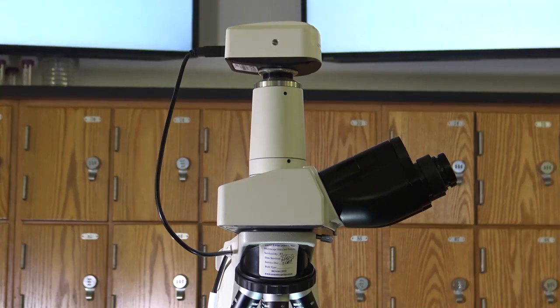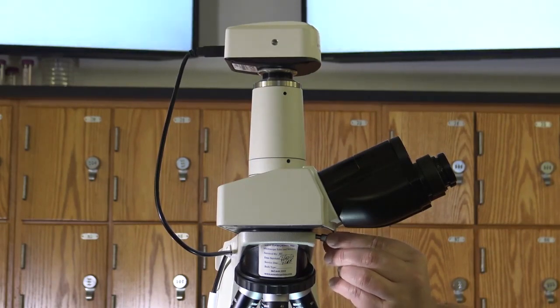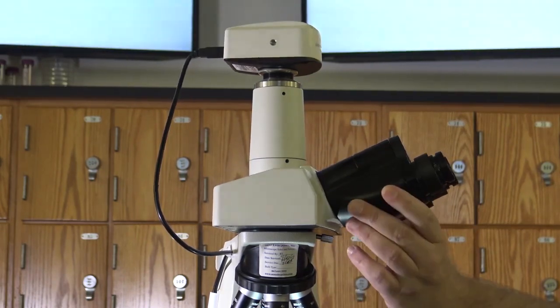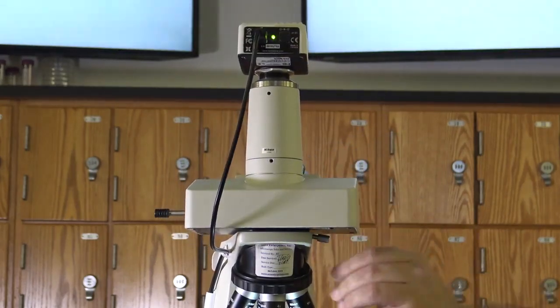The trinocular head only differs from the traditional head in that there is a camera attached that is capable of recording and snapping pictures of your images. These images can be used as part of your unknown report later in the semester. The traditional head does not have this camera. In order to rotate the head of your microscope, please turn the knob that's on the side of the microscope and loosen it, thus allowing you to rotate the head around.